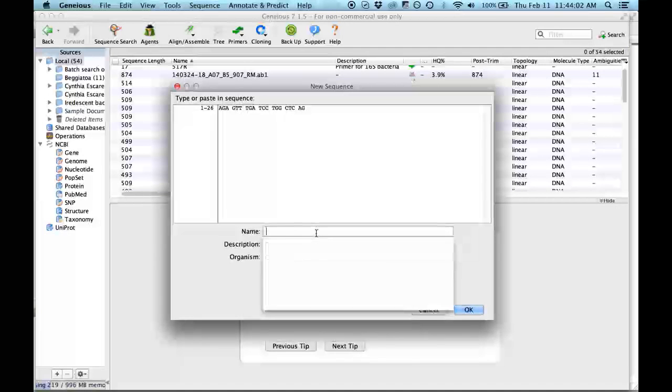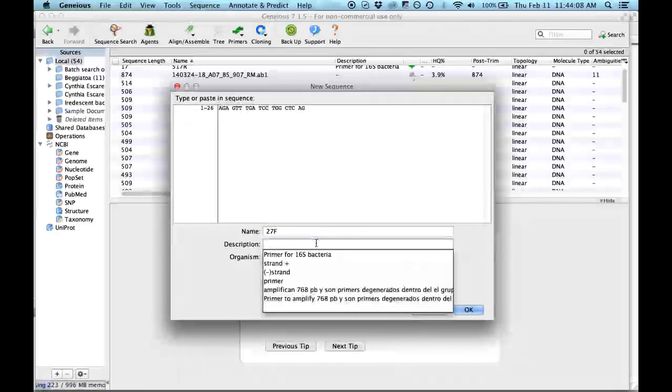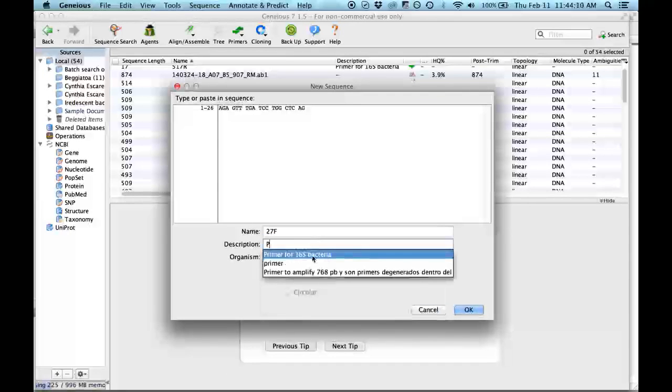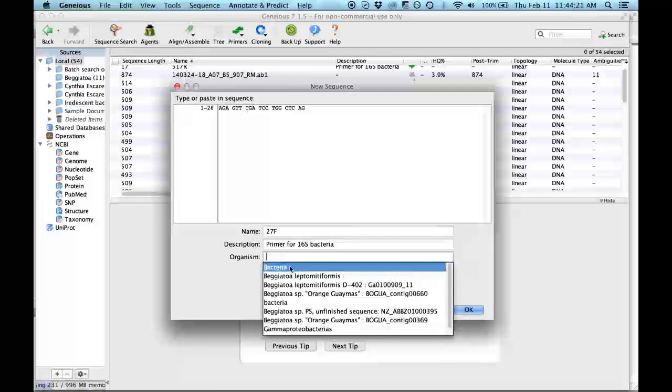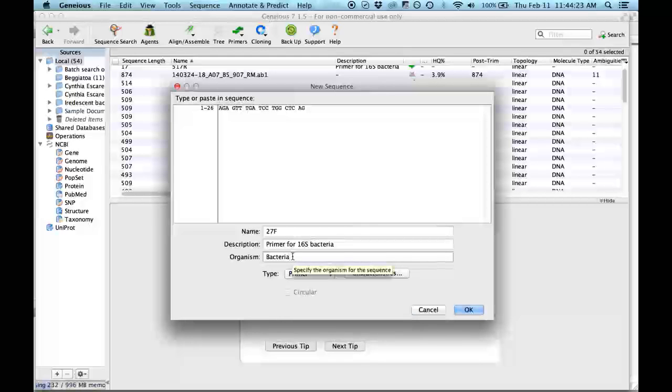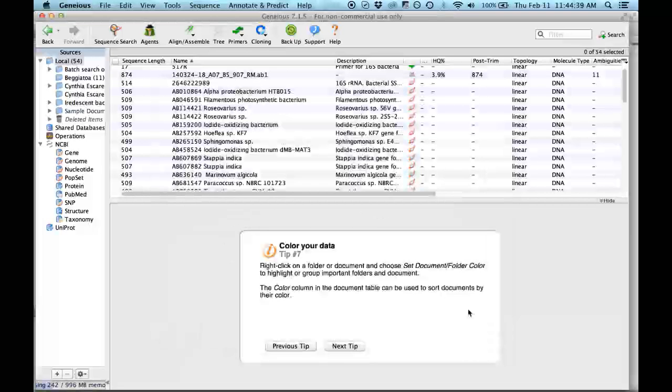We will give the name of the primer 27F, and I will write that it is a primer. This appears here because I already wrote it before when I was doing the first video. But basically you put here what it is. It's a primer for 16S of bacteria, and you can put bacteria here also. You can write everything that you want. The important thing is here where you put that it is a primer. That is how the program knows that the sequence here is a primer, not a nucleotide sequence or anything else. So it's so important that you put here primer. And it's saved.